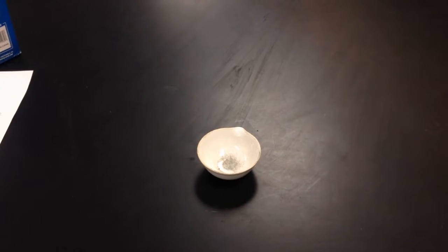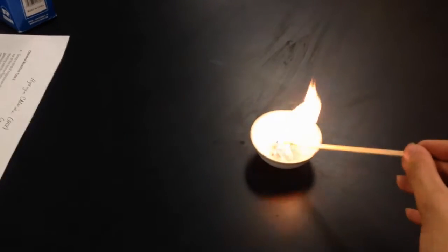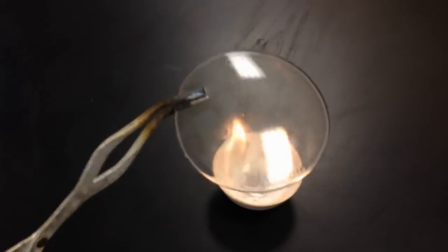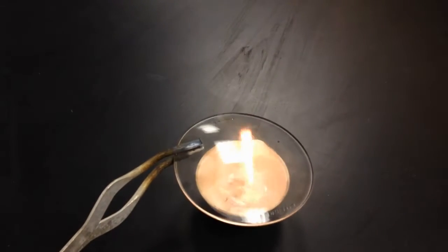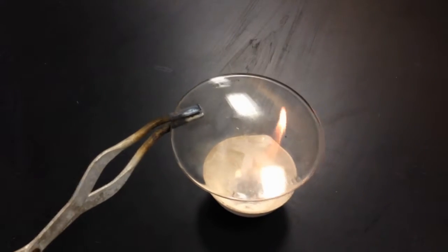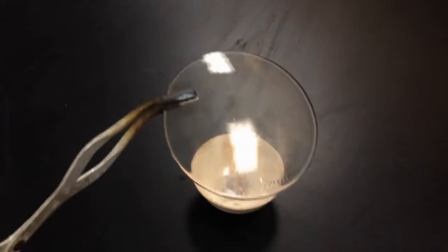And finally, we're down to our last reaction, and this is underneath the Chemical Reaction Type 5 section, and I'm going to take a few drops of isopropyl alcohol and then ignite it with a wood splint, and Mrs. Sockleben here is going to place a watch glass over it so that you can observe the condensation that forms on the watch glass. Now, you can't see it clearly here, but there is condensation that forms.